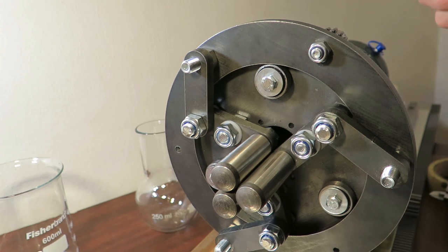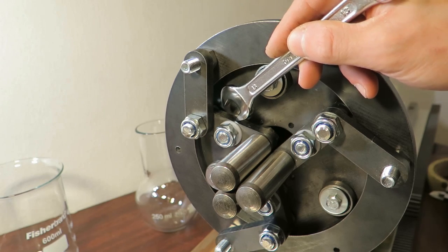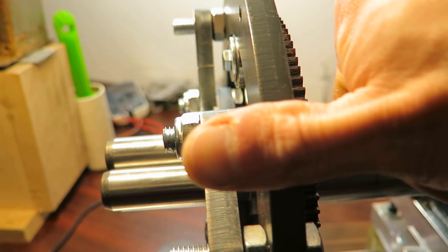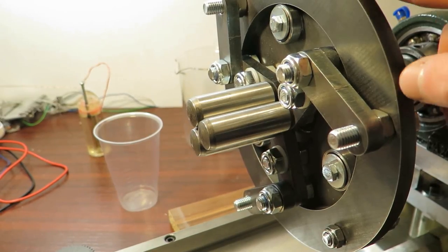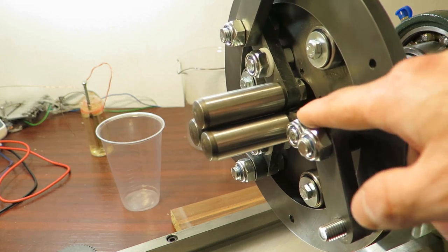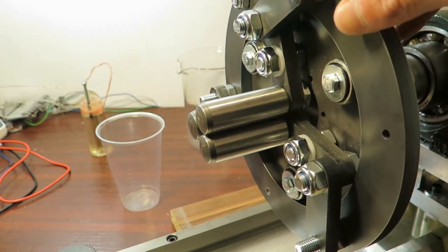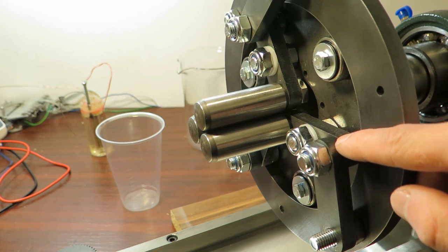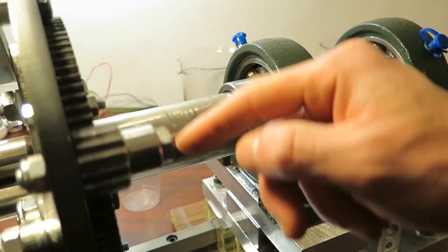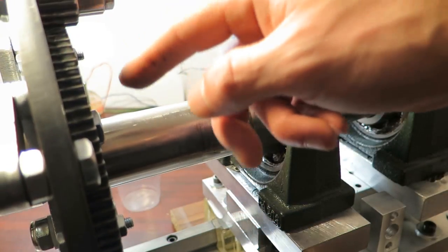Oh yeah, and I forgot to make my point there, because I changed my mind and I'm not using pins there. This material does not have to be so thick. Right now it's about 10 millimeters, so it's about 3/8 of an inch. Well, maybe. So making this from thinner material will reduce cost quite considerably. For example, this can be 2 millimeters. This I would keep at least 6, because it has to be quite stiff. This outer ring, 3 millimeters, and this spur gear I would leave about the same, maybe 8 millimeters instead of 10, maybe even 6 would be okay.